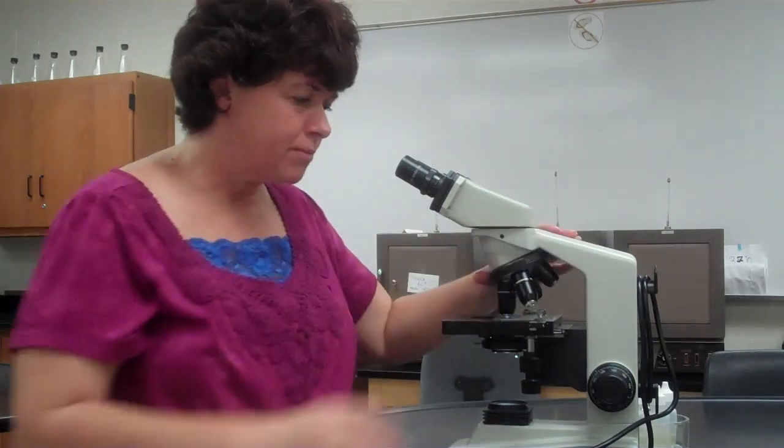When we do the gram stain, you are distinguishing between pink and purple. It may be pink without the oil, purple with the oil. The correct answer is purple. So you have to use the oil immersion. To use the oil immersion, I don't want to get any oil on this lens. The only lens that can ever have oil on it is the 100. Let me repeat that. The only lens that can ever have oil on it is the 100. Getting oil on the 40 or the 10 is very, very bad. It will permanently damage the microscope.